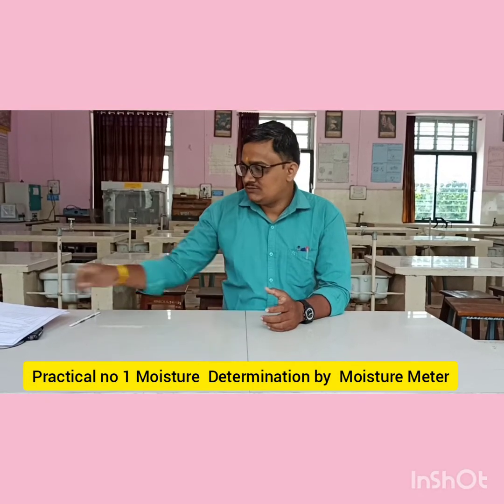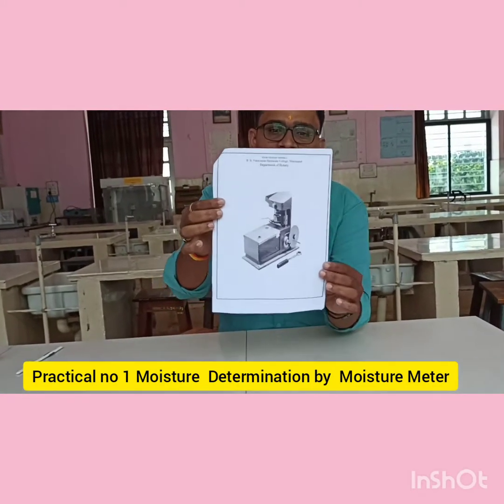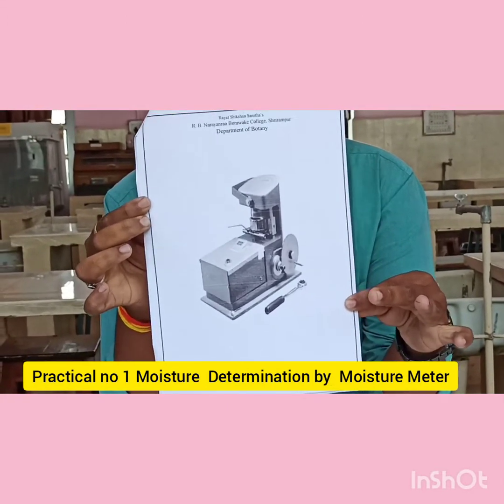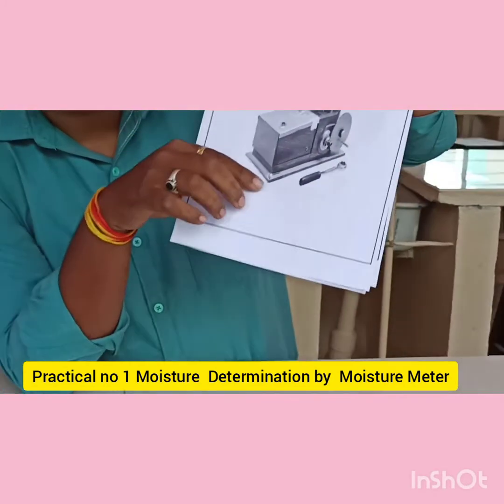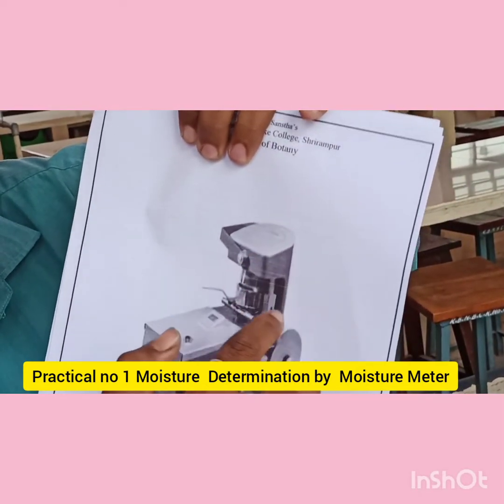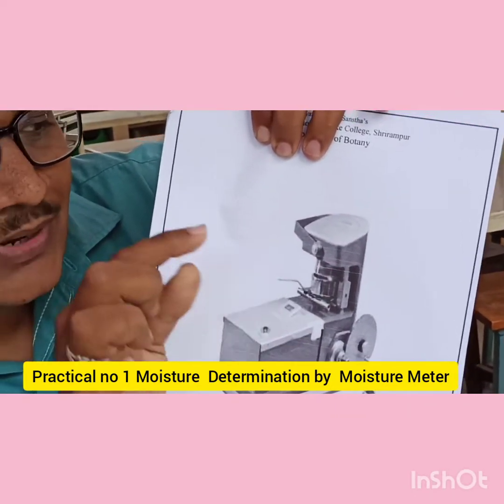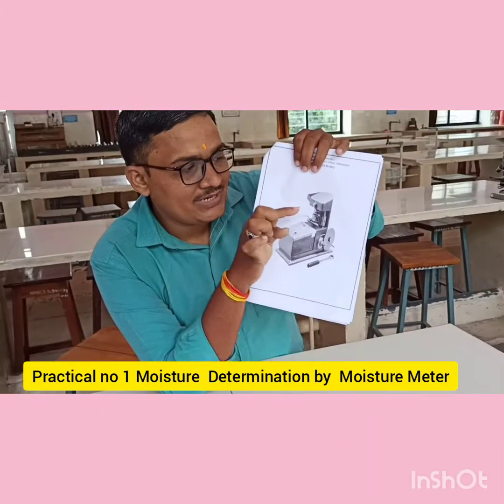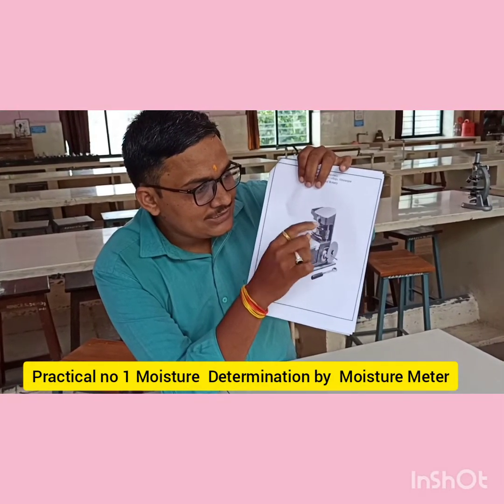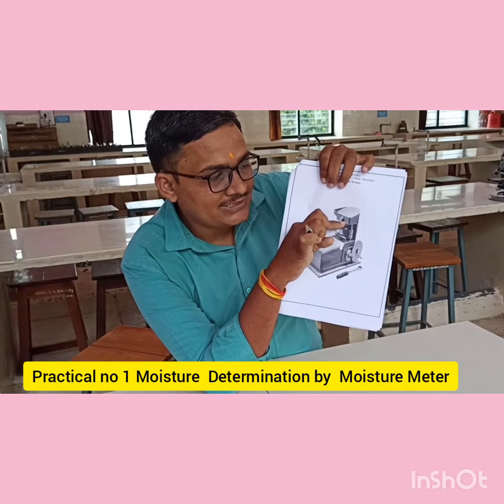First we see the moisture meter. The digital moisture meter is used in general for industrial purposes to determine the moisture in a seed. The structure consists of the body of the moisture meter, the gear, and the handle. In the handle and body there is a test cup present. In that test cup the seed sample is poured. After pouring the seed sample in the test cup, we have to rotate the ratchet gear. When rotating the ratchet gear, the seed sample in the test cup is compressed with the help of a plunger.